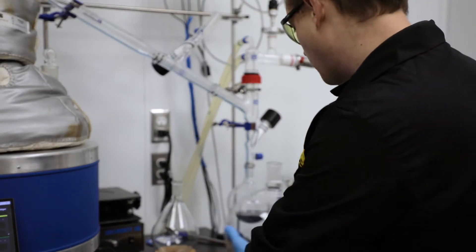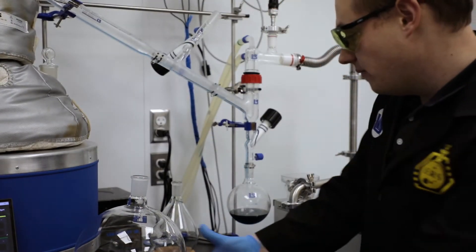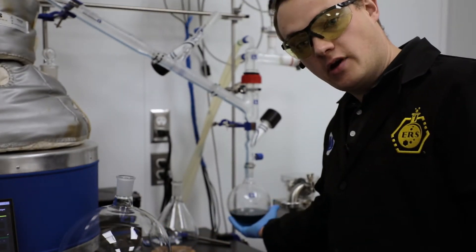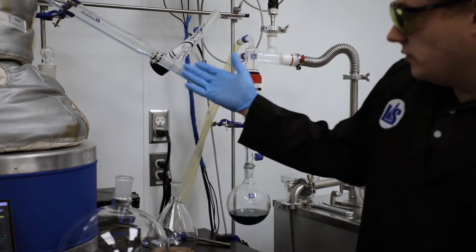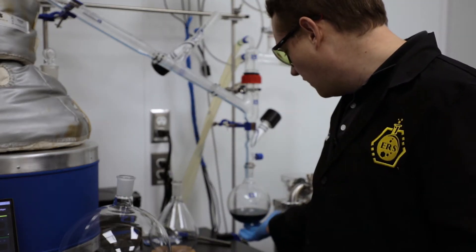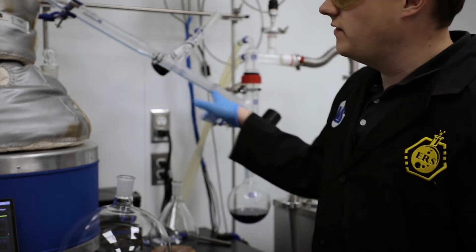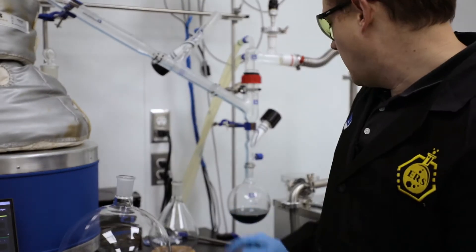As you can see, I've got all my flasks prepared for my valve system over here, and I'm collecting into my secondary collection right now. The liquid coming out is a high-viscosity blue liquid — azulene, as a lot of people would call it. And in here I've got a very low-viscosity liquid, more watery, so I want to get a sample so we can test it on our mass spec as well as our HPLC to see what's in there.